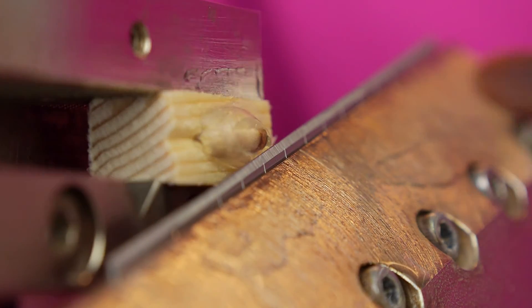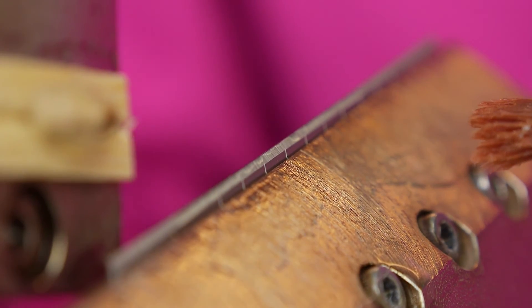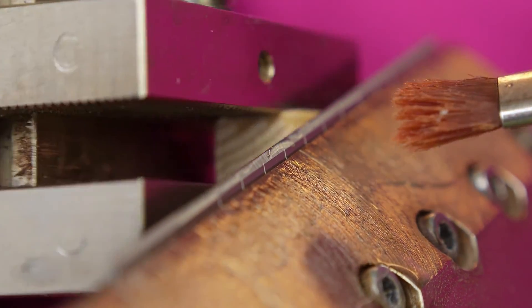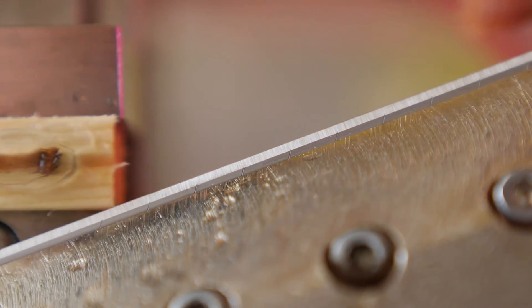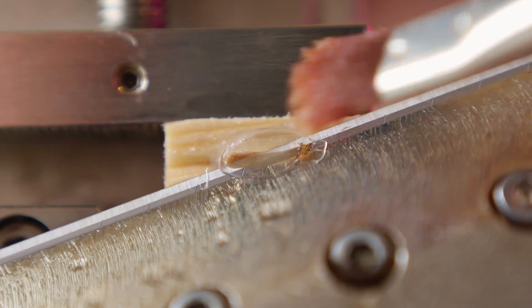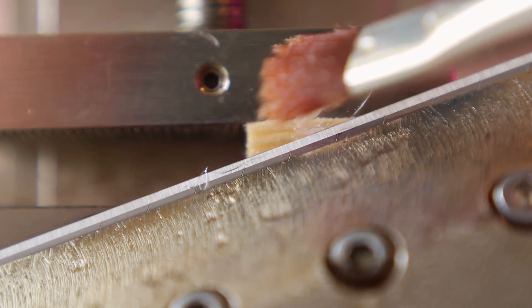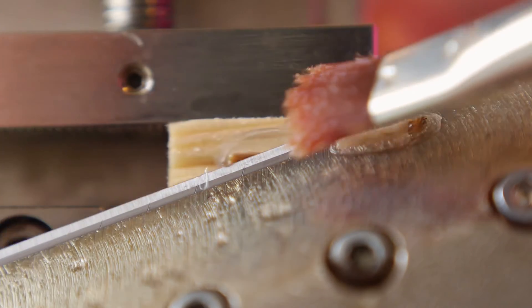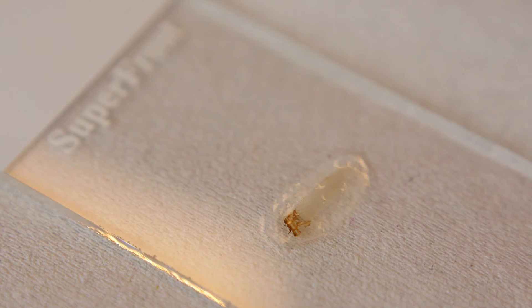Let the sample approach the knife and cut several times through the glue until you reach the actual microcore. Depending on the species, choose a thickness between 5 and 15 µm. Place the brush on a thin section to prevent the cut slice from curling. Put the slice on an object holder and use water to keep the slice wet.